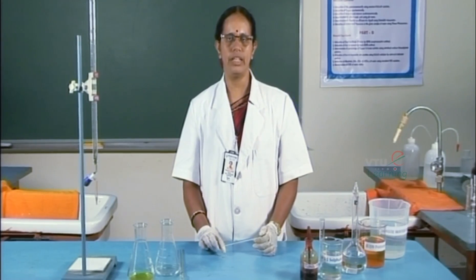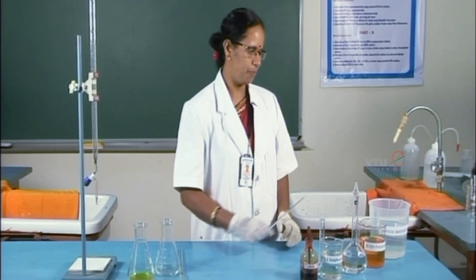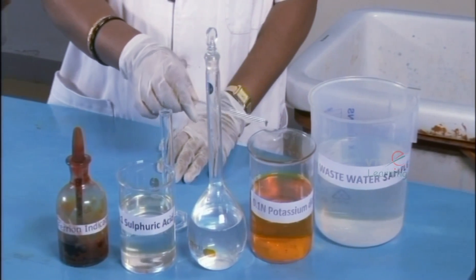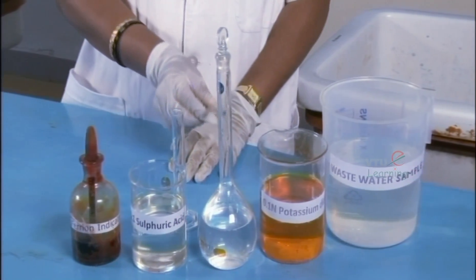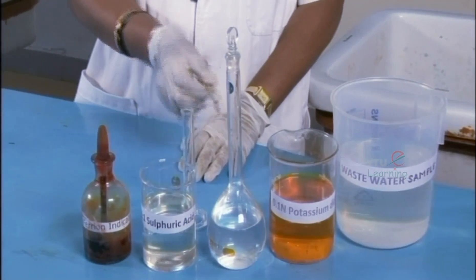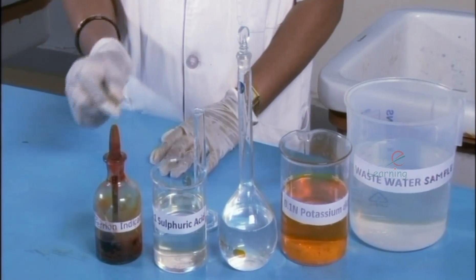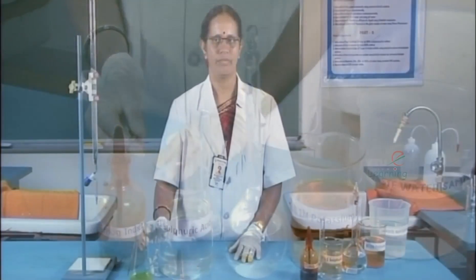The reagents required for the experiment are as shown: the water sample, the oxidizing agent, the potassium dichromate solution, standard FAS solution, one-to-one sulfuric acid, and the indicator used is ferroin indicator.